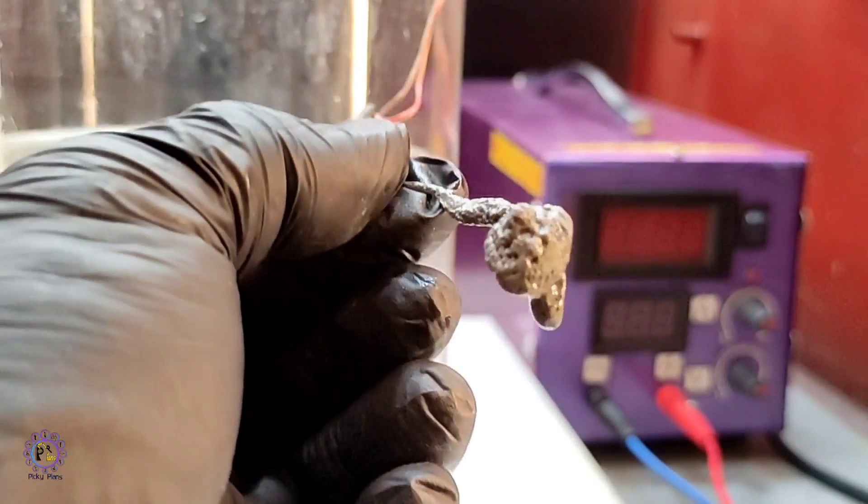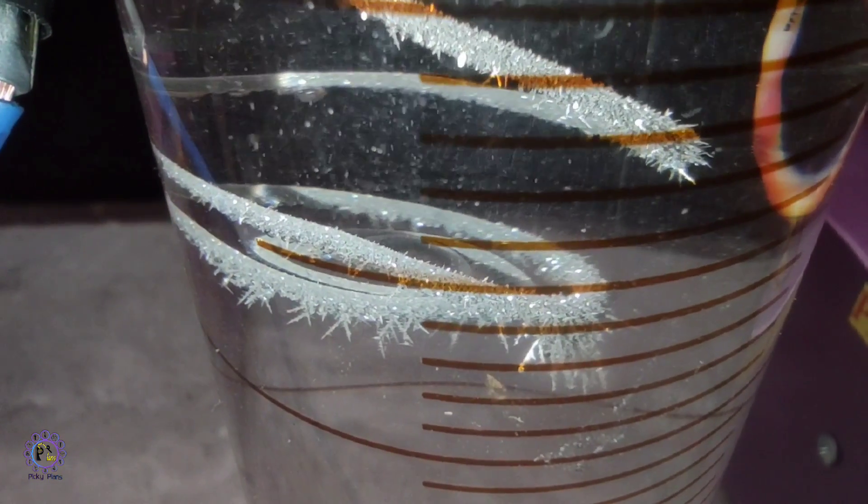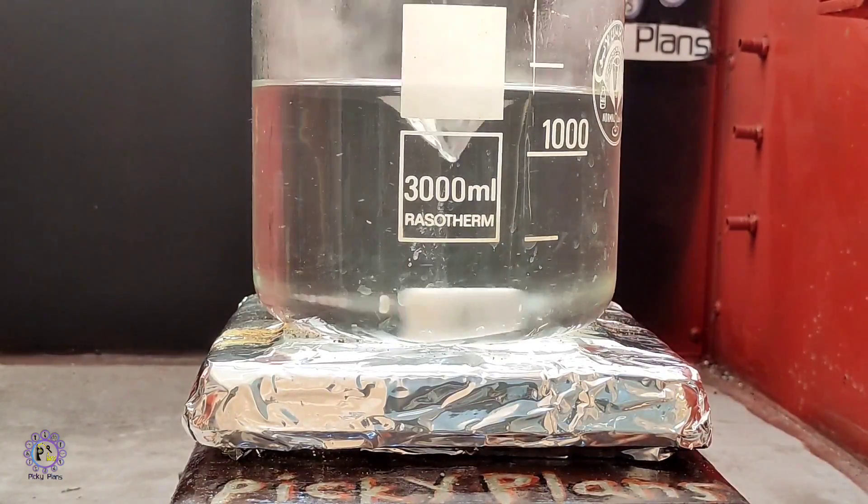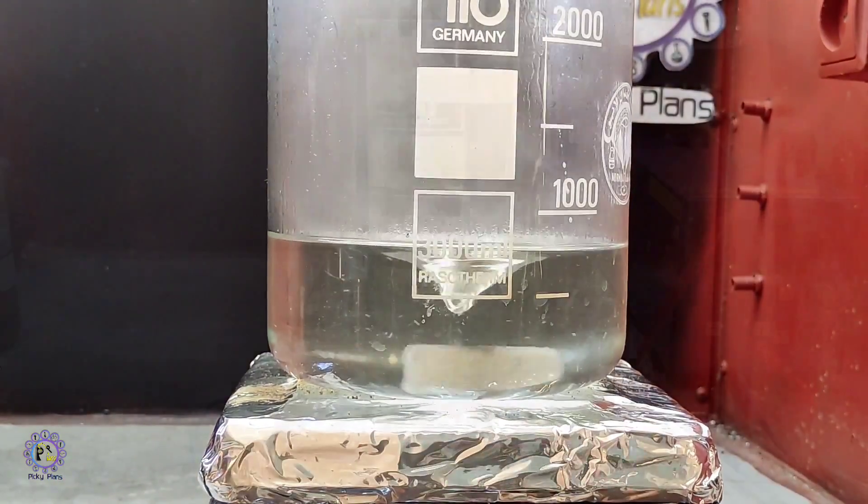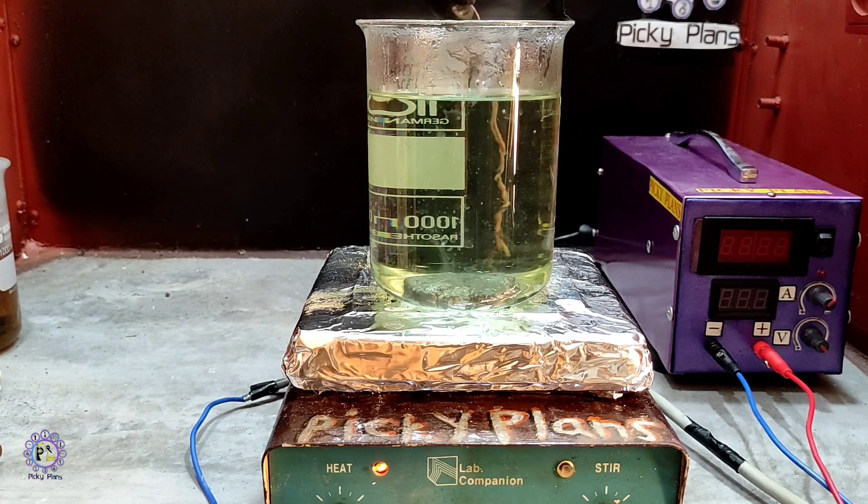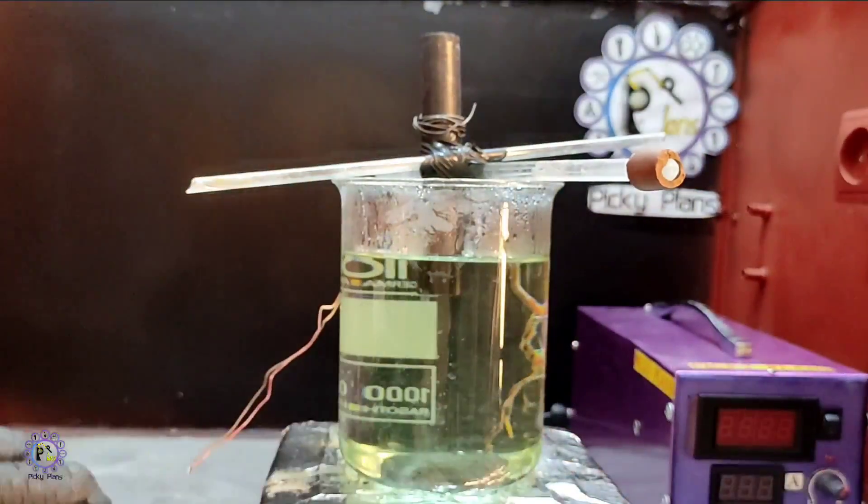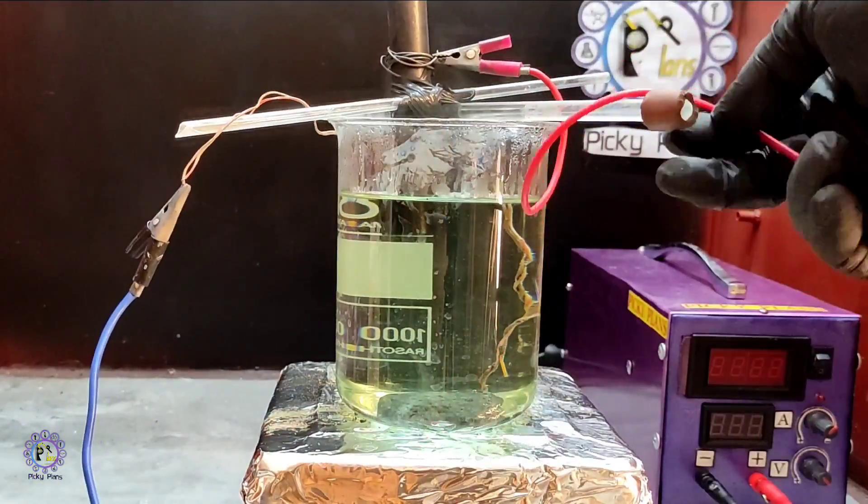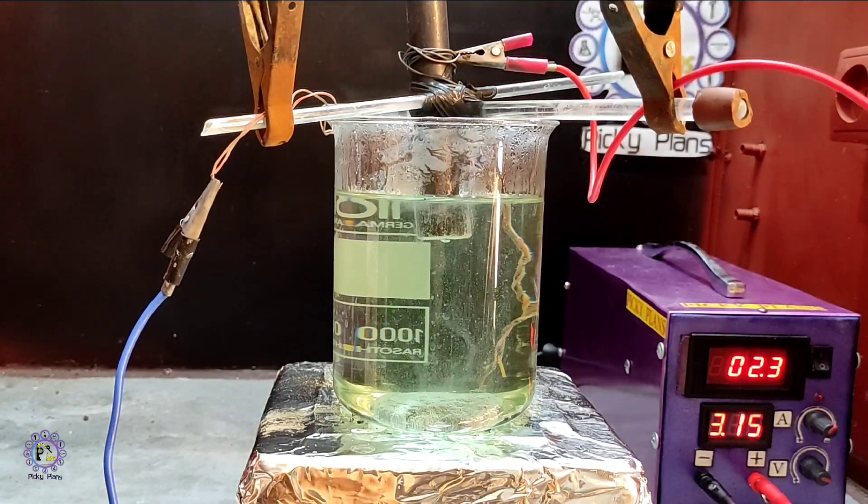After dilution, it yielded growing sponge mass of tin metal. Before dilution, I tested solution and sharp tin crystals grew successfully. I had to concentrate solution again. Solution been concentrated and electrodeposition started by lead cathode and graphite anode. I placed lead cathode at the bottom of the cell allowing crystals growing from the bottom to the top to prevent crystals from falling and losing connection. Otherwise, crystals would become tarnished.